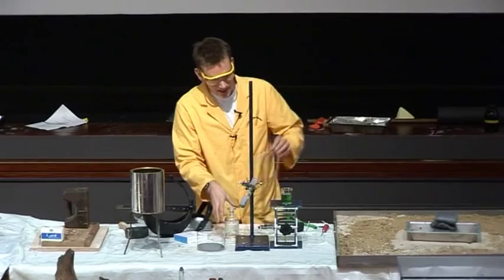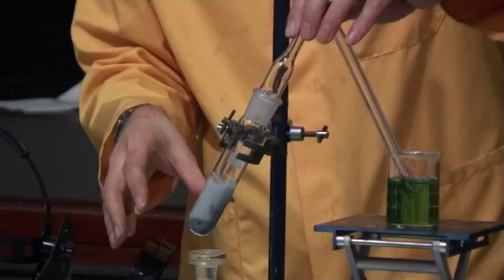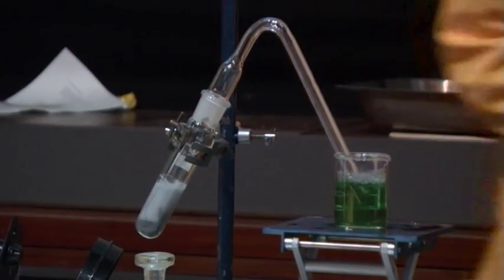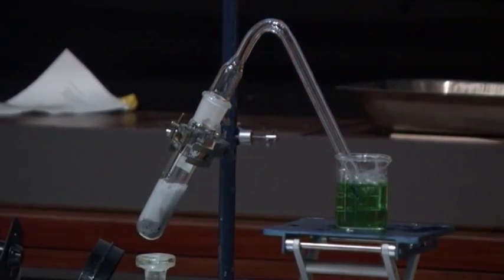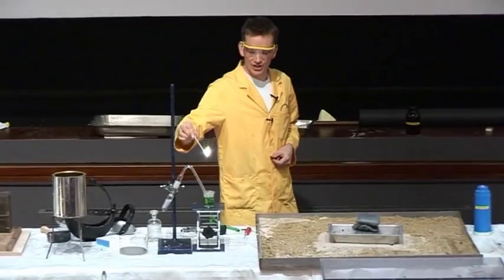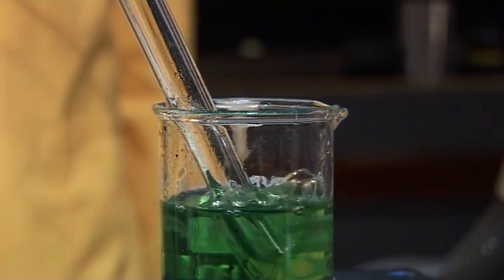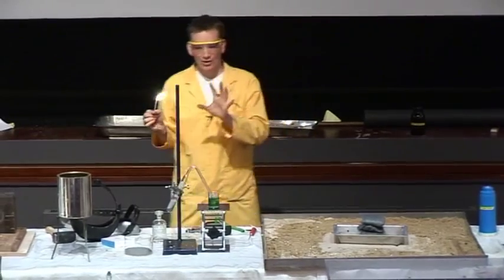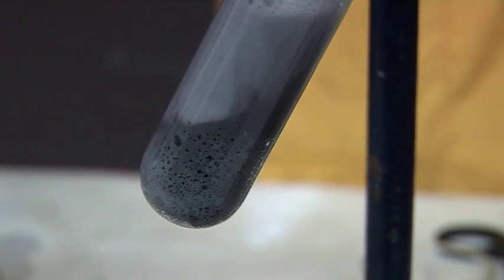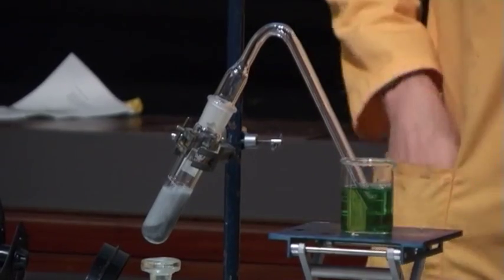And it's bubbling away very vigorously. And get a light. This is hydrogen gas now, being formed by the reaction of the iron with the acid — the sulfuric acid. It's a flammable gas.